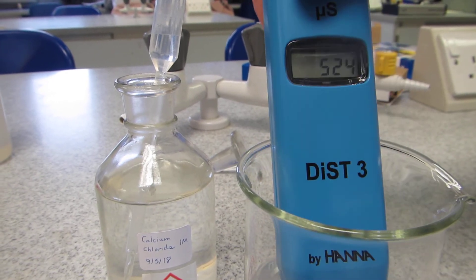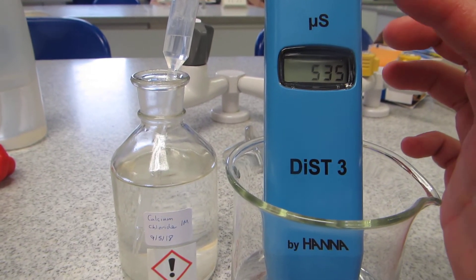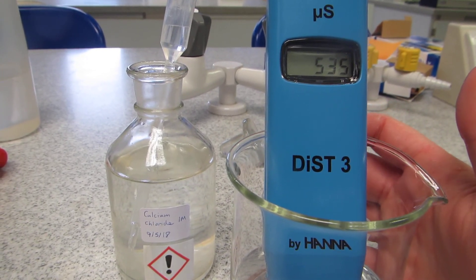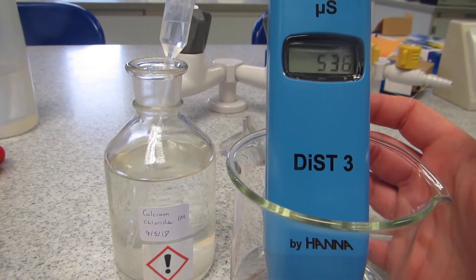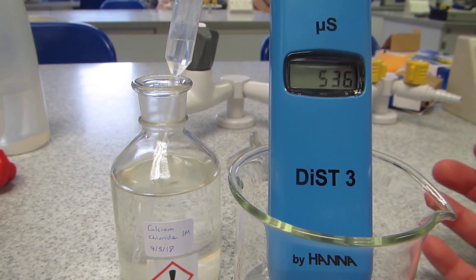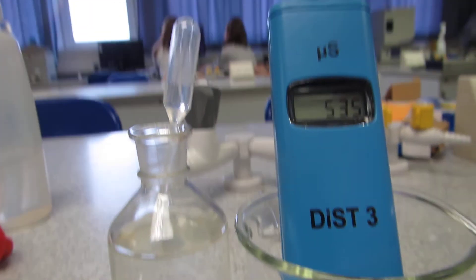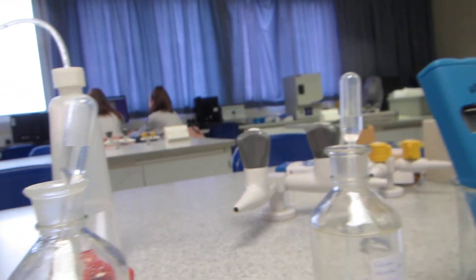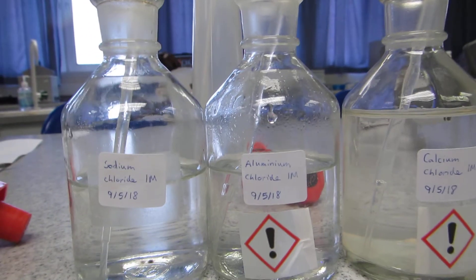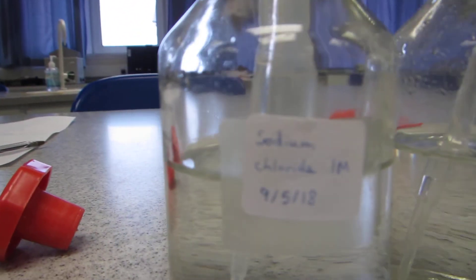Once it's settled I'll talk you through the units. All of these measurements have been done in the symbol µS, which stands for microsiemens, and that measures how many ions there are that will affect the conductivity of a solution. The more ions there are in a solution, the more it's able to carry charge. Now you have results for sodium chloride, calcium chloride, and aluminium chloride, and you can compare how adding one drop of one molar of each of these salts affects conductivity. The ones that carry charge best will have increased the conductivity the most over the ten drops.